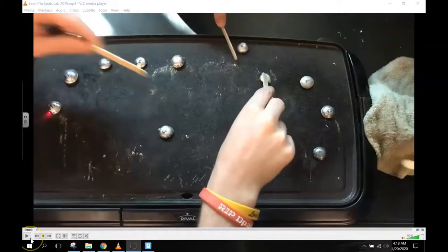So what we're going to do is watch the video of last year's lab where each student was assigned a spot for the lab. Each student was in charge of watching one spot and just determining when it melted. Another student was in charge of recording the data, and still another student was in charge of recording the temperature at which they melted. There you'll see a laser thermometer recording what's happening. So let's go ahead and see how things are going.